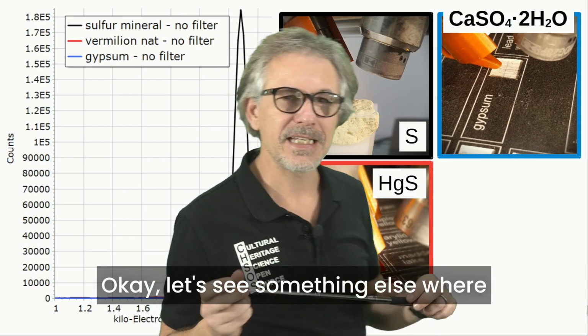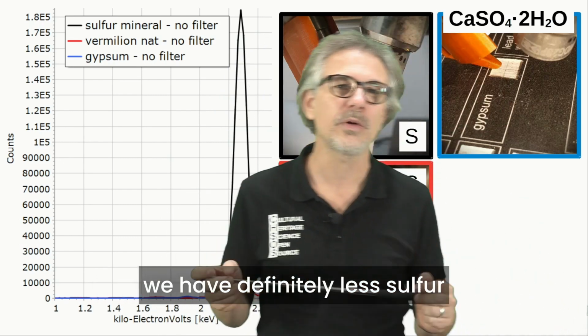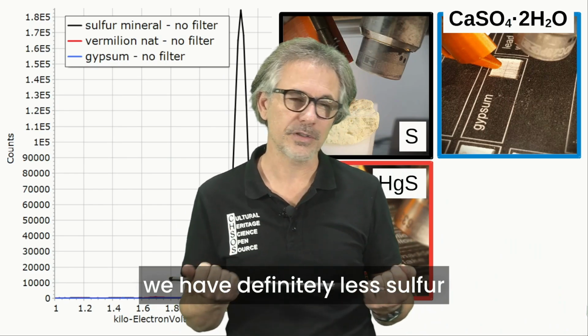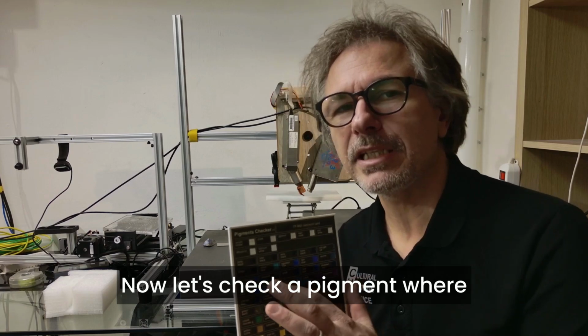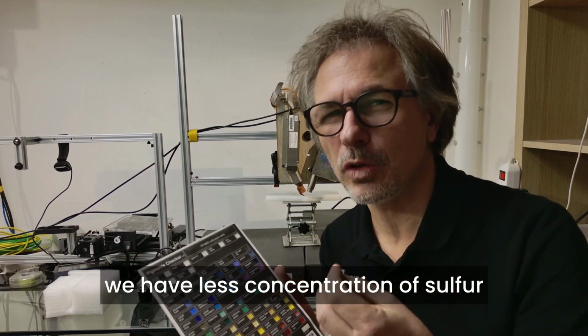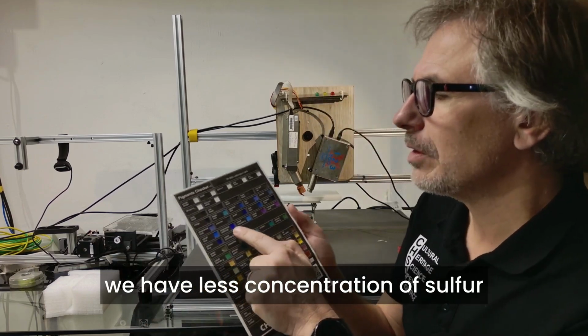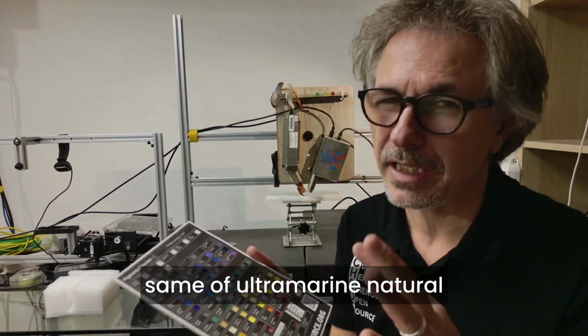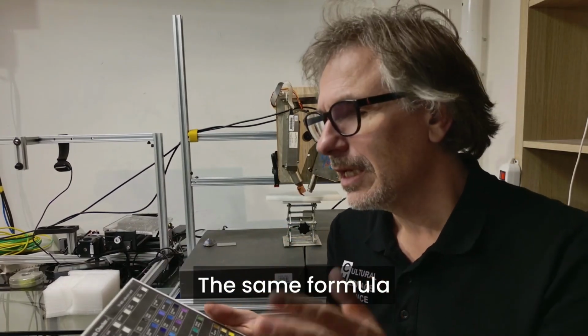Okay, let's see something else where we have definitely less sulfur. Now let's check a pigment where we have less concentration of sulfur. Artificial ultramarine, which is the same as natural ultramarine, the same formula.